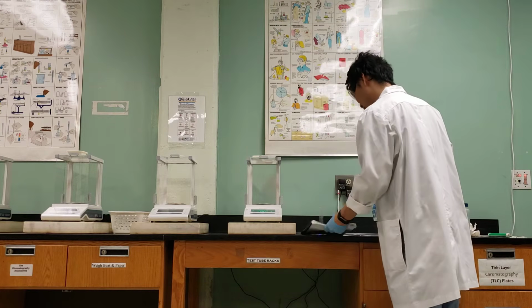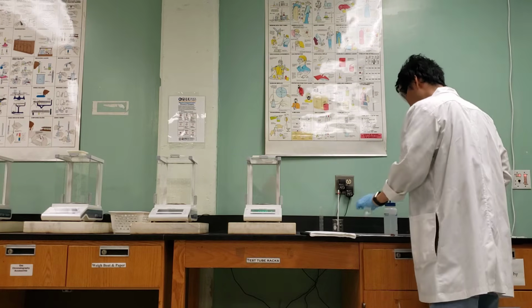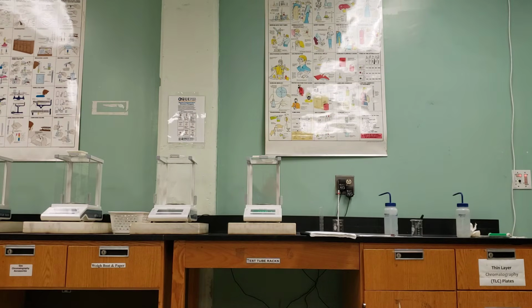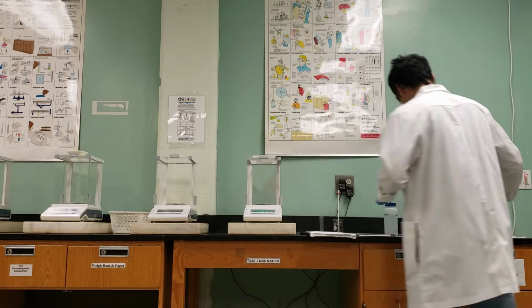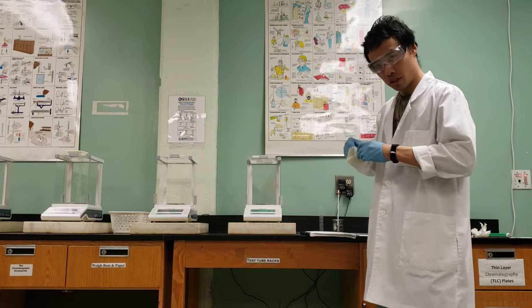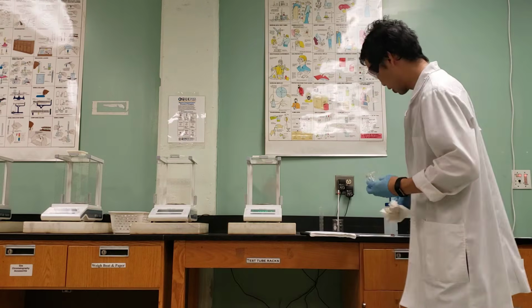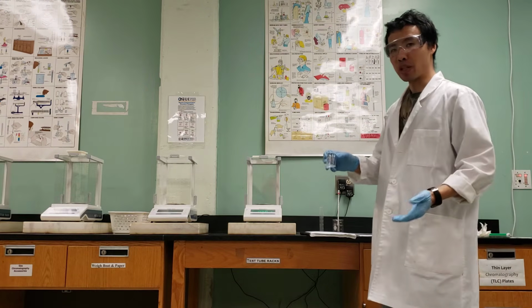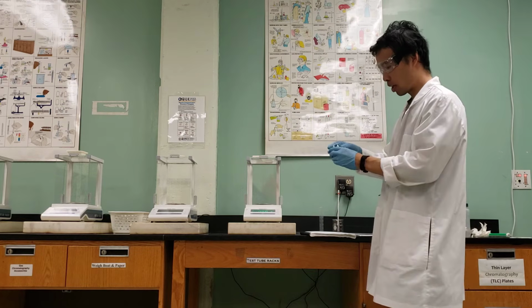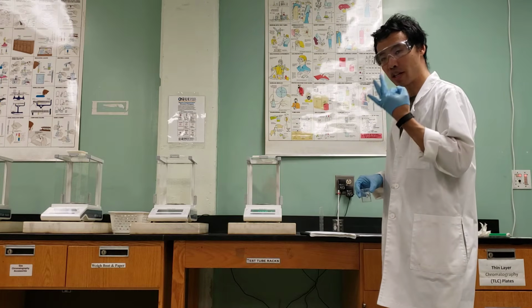The next step, step number 6, says to repeat this experiment. So what I'm going to do is pour out our water and dry out our container. And I'm going to repeat this measurement, meaning I'm going to measure 10 mils of water in our graduated cylinder, pour it into our beaker, and measure the mass, to repeat the experiment to get 3 values in triplicate.